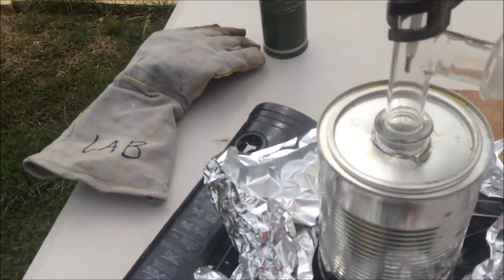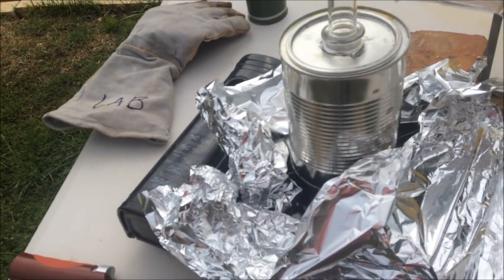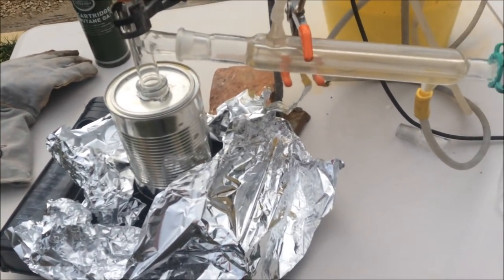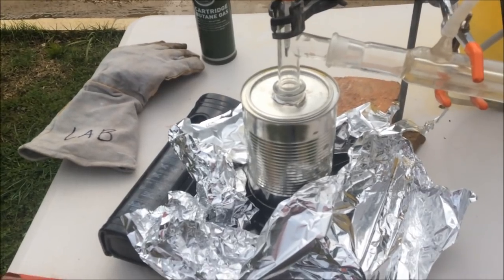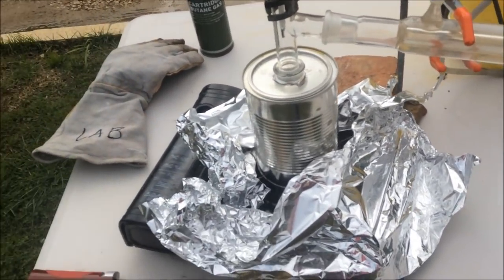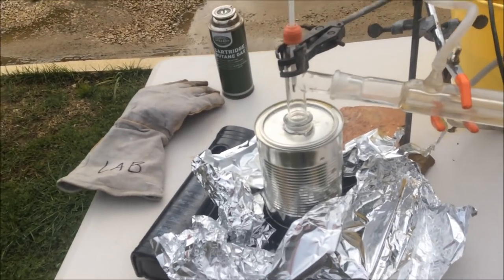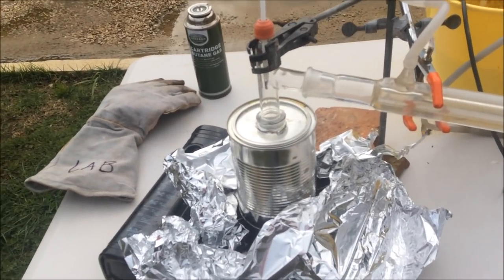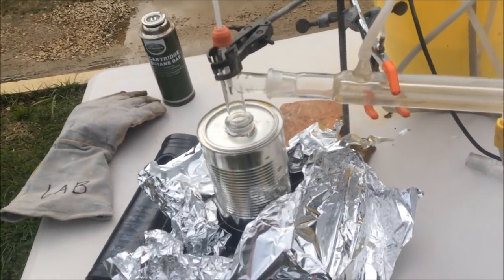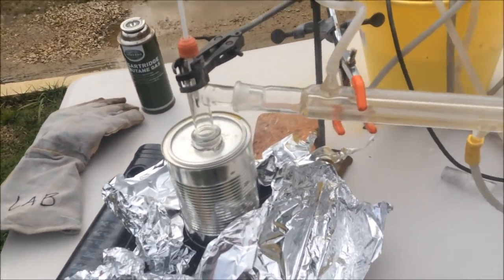But we've gone all the way up to 100 now. But, yeah, this is really unpleasant. So I don't think we're going to make it to 200 degrees. I might have calmed off a little bit now, but, there we go. Alright, no, I've got to stop this. The seal isn't holding either, so we've got to approach this a different way.